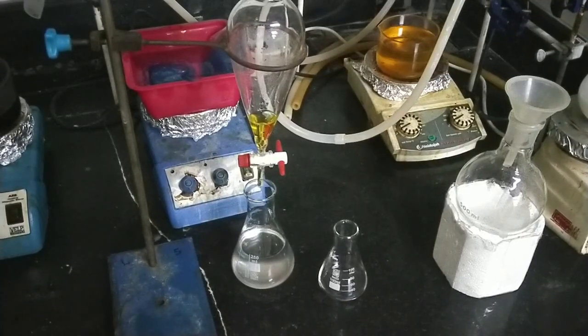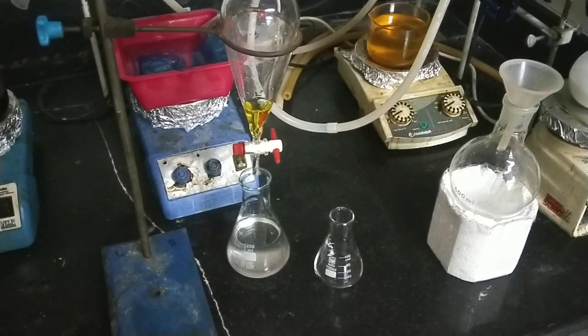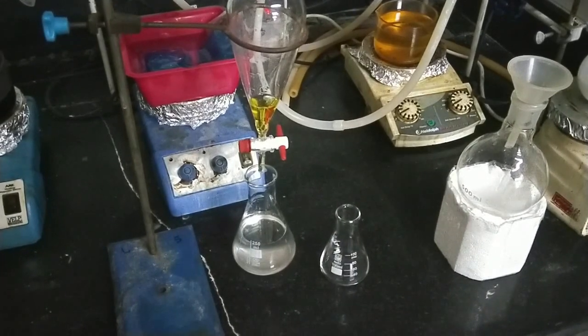In this stage, it's time to change the Erlenmeyer flask and save the product.